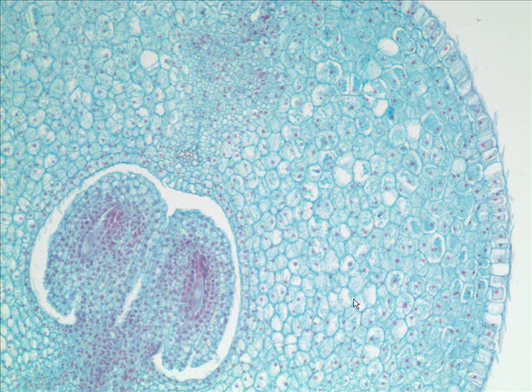All right, we have our final little video for test number 2. What do we have here? Well, out here we have something. Where are we in this flower anyway? We are low on the pistil. And so, this must be what down here? It must be the ovary, yes. And what are these guys here? They are ovules. How many ovules do we see in this picture?